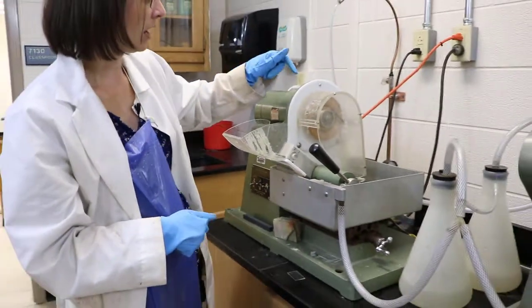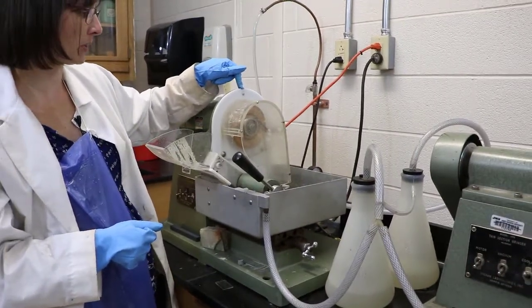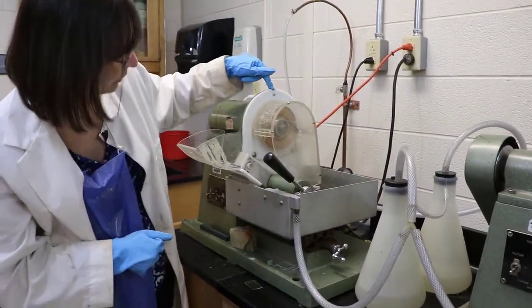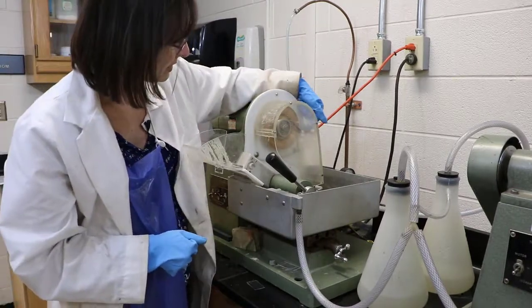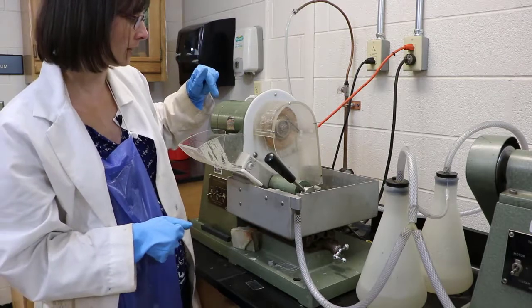There's also a water supply. So just like our other saws we need a lubricant. And so we have a tube in here that actually brings water and makes it in contact with the rock saw surface.